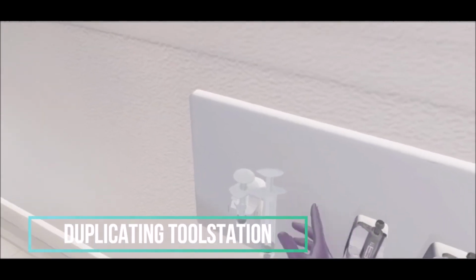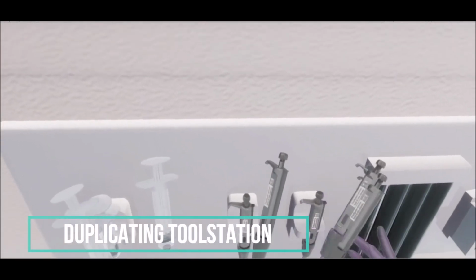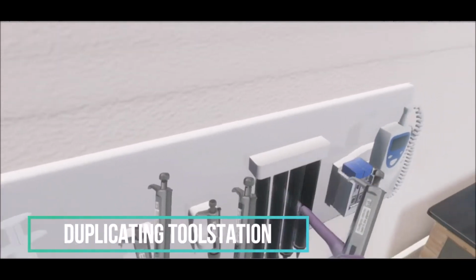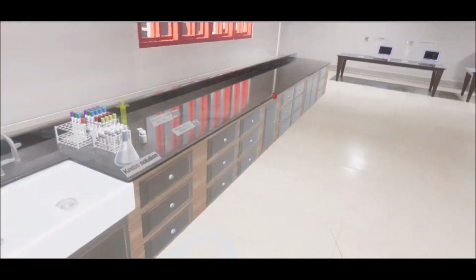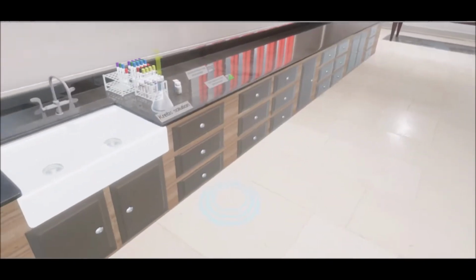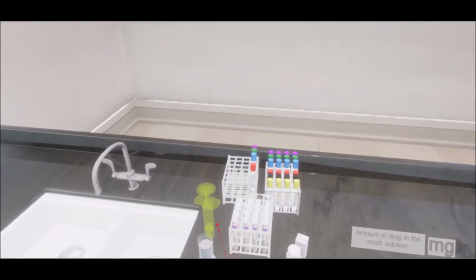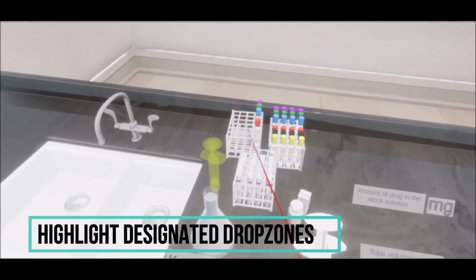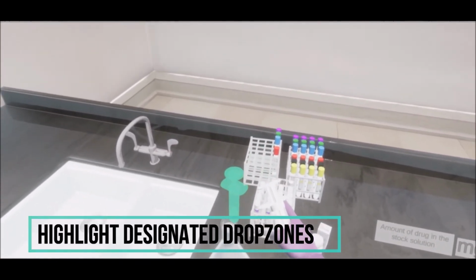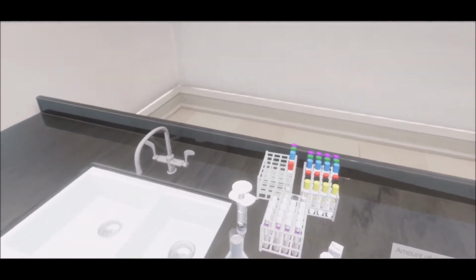This is the tool station where the students can take the micropipettes for use in the subsequent parts in the VR lab. The VR lab is divided into two parts. The first part is the drug dilution station. This is where students will dissolve the drugs in solvent to produce different concentrations of drug solutions for use in the second part.